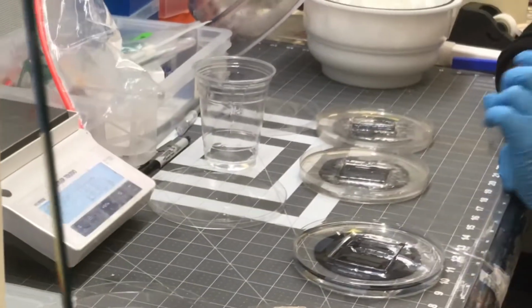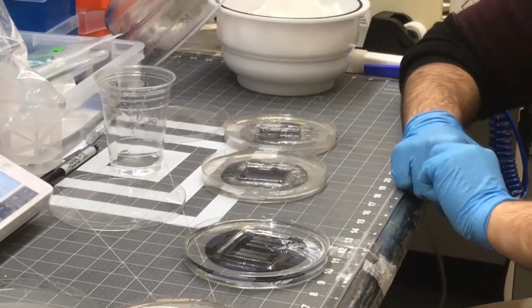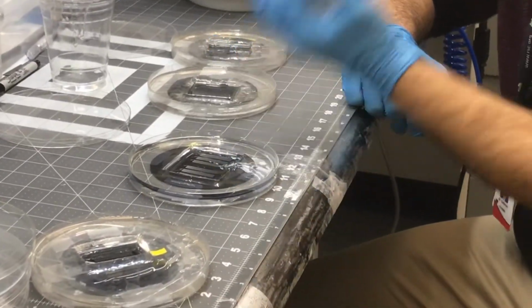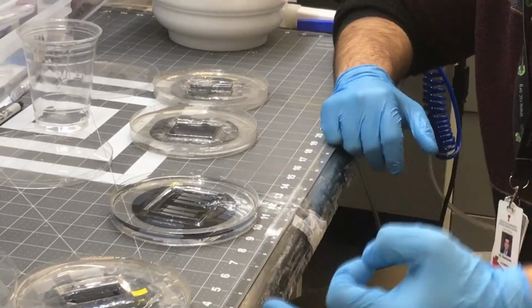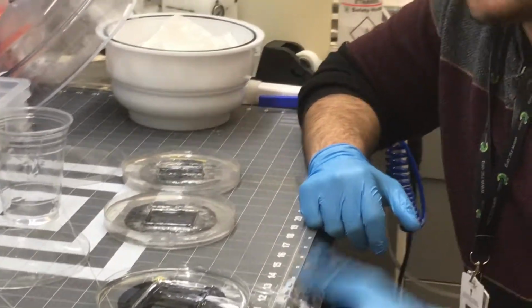So for this reason, you have to balance this, and I highly suggest that you calculate the height that you need. For example, if you need 5 millimeters, you can understand the height based on the literature. You can find, for example, what height other people use. The height of the chip. Height of the chip.